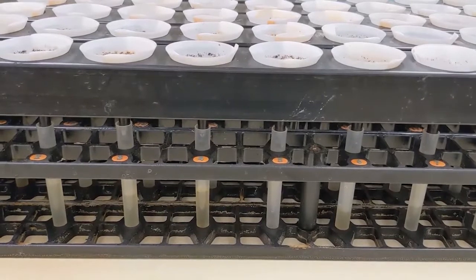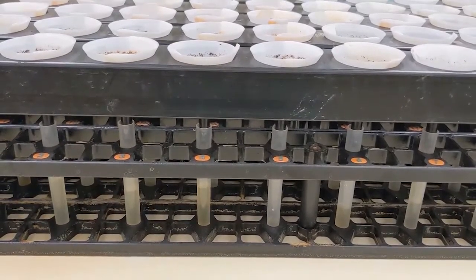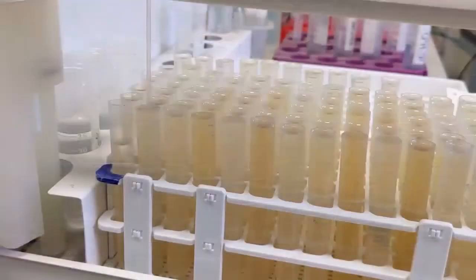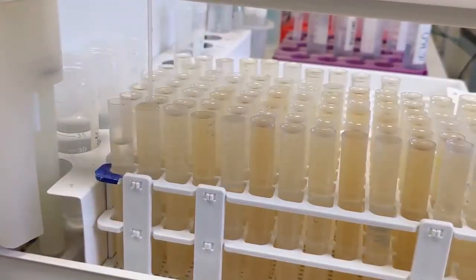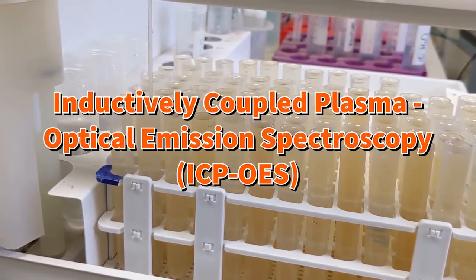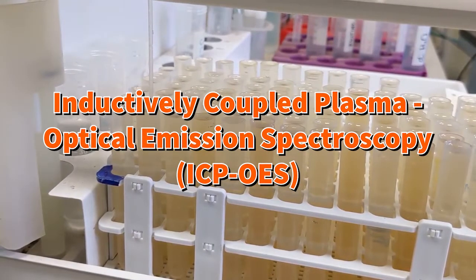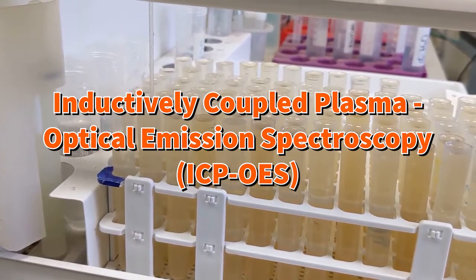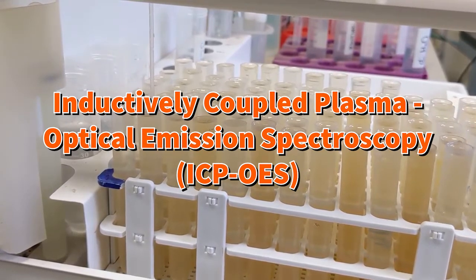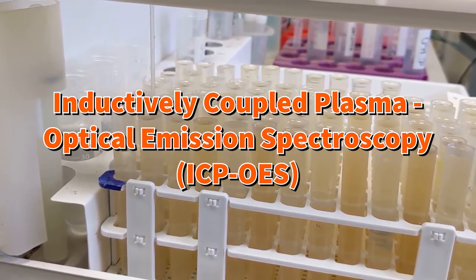These test tubes will be loaded onto our mineral analysis instrument. This instrument uses Inductively Coupled Plasma Optical Emission Spectroscopy, or ICP-OES, to analyze the elements included in a standard soil test.